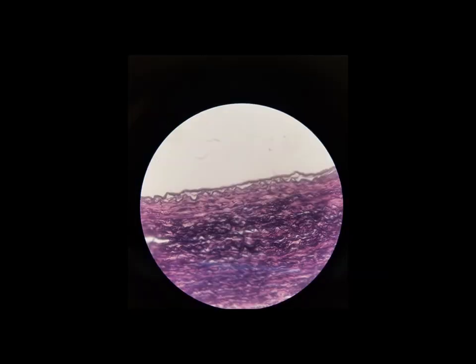And the last tissue that we will look at for this lab is elastic connective tissue. And elastic connective tissue we find several places throughout the body, but the best example is in the walls of your blood vessels. And when we look at this, we see all these really dark lines, and those dark lines are elastic fibers. And we can see that those elastic fibers are kind of wavy, kind of folded, and that's because this tissue is unstretched. This is, again, the wall of the blood vessel, and if we were to stretch the wall of this blood vessel, then instead of having this wavy appearance, those elastic fibers would be straighter.